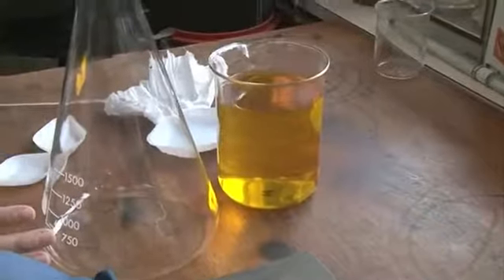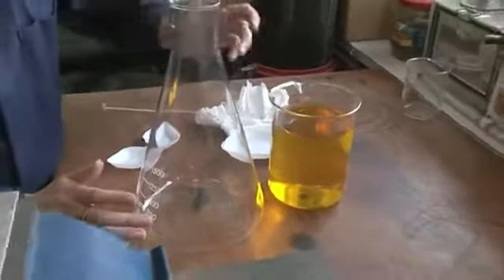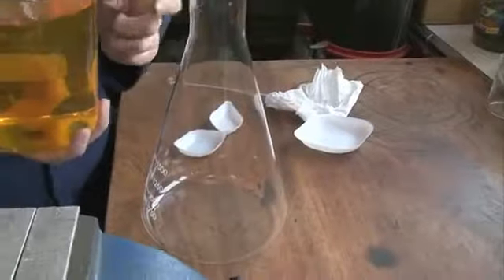Look, you can actually see some of it isn't dissolved, and you can see where the colour's coming up from the bottom. That's really cool. Okay, so this is actually a reversible reaction. So what we need to do is, all the component ingredients are already suspended in the water. What we need to add to this is oxygen from the air. So we're going to tip this into here, and you can see what happens.